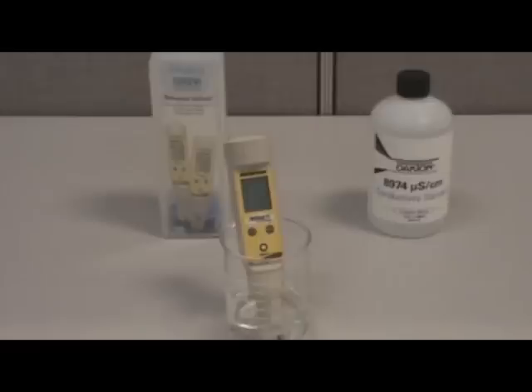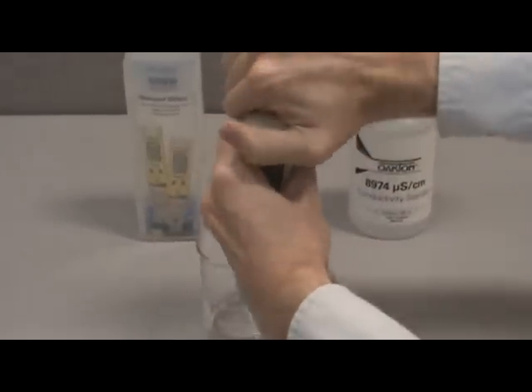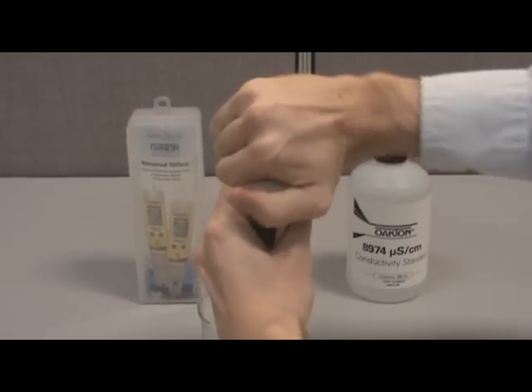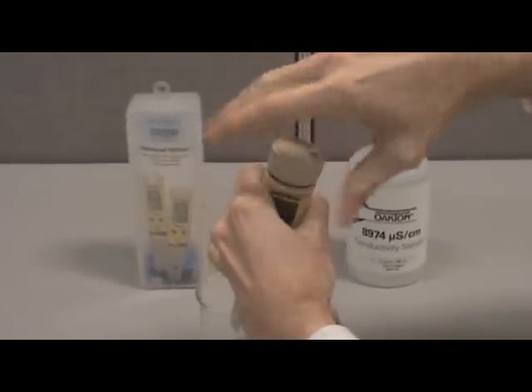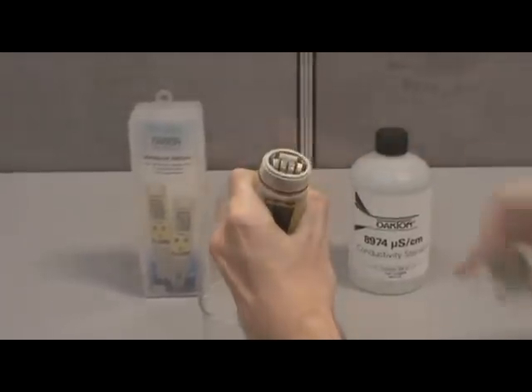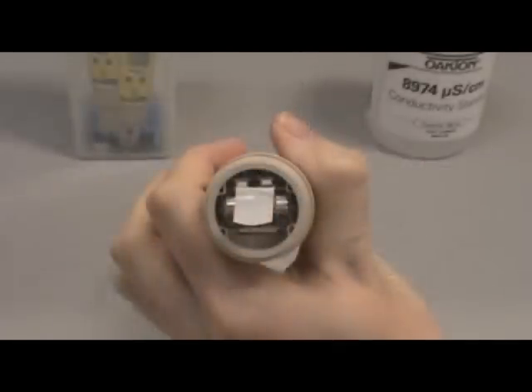To ensure an accurate and stable calibration, you should condition your tester in water or alcohol for 30 minutes prior to calibration. Before we can begin calibration, we need to gain access to the control buttons located in the battery compartment. To do this, grip the tester firmly in one hand and twist off the battery cap in a counterclockwise direction. Be sure to retain the O-ring located underneath the cap. You can now see the increase and decrease buttons along with the batteries.